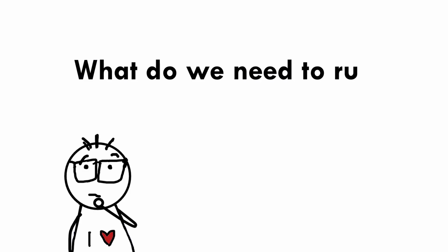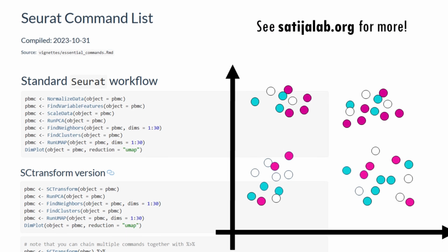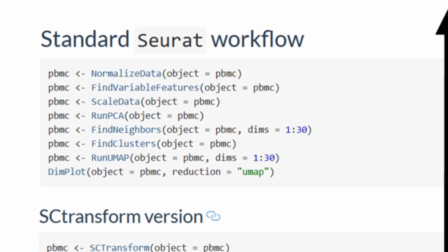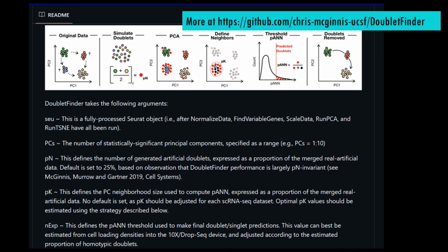So first, let's go back to DoubletFinder. What do we need to run DoubletFinder? It essentially needs a Seurat object, a fully processed Seurat object, that is, after normalizing data, finding variable genes, scaling data, running PCA and running TSNE, and 4 additional arguments: PCs, PN, PK and NEXP. PCs is the number of statistically significant principal components, and we will automatically select it for each sample separately.